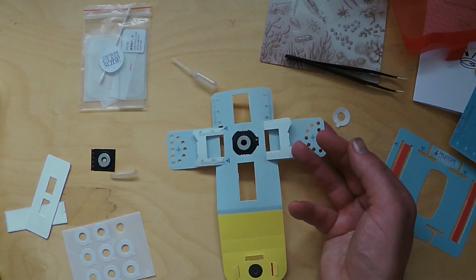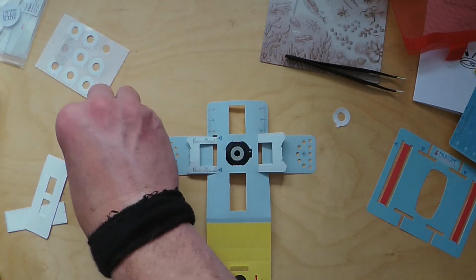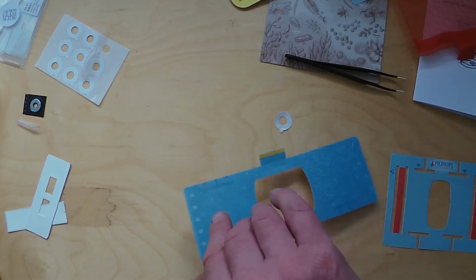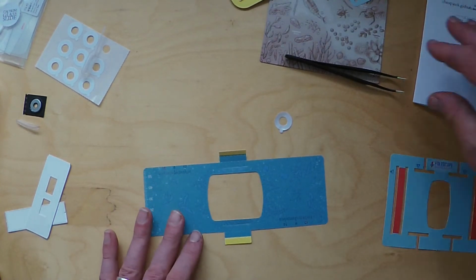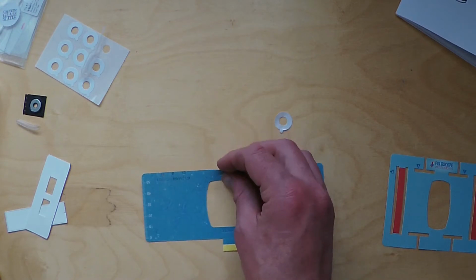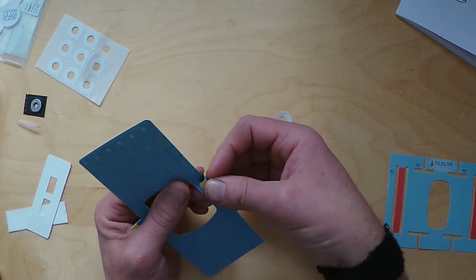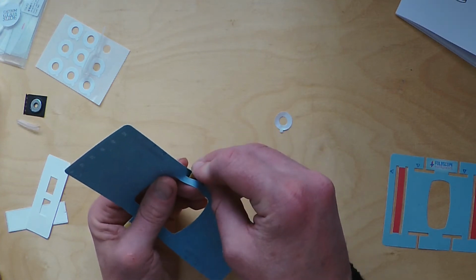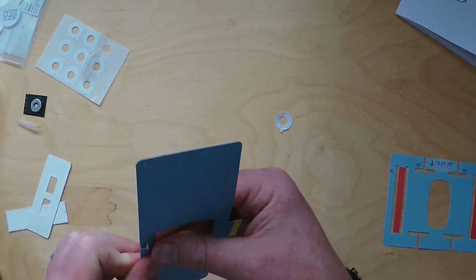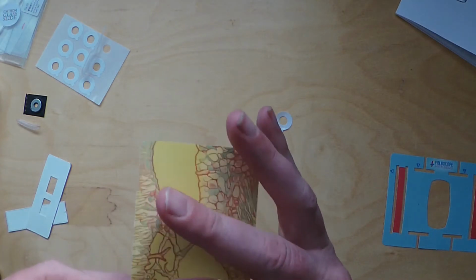Next step is take our sample stage, so we'll move our things out of view for now. Put this to one side. Here's our sample stage. Just checking we're running still. Yeah, okay. So tuck these sections in. That's a bit tricky.